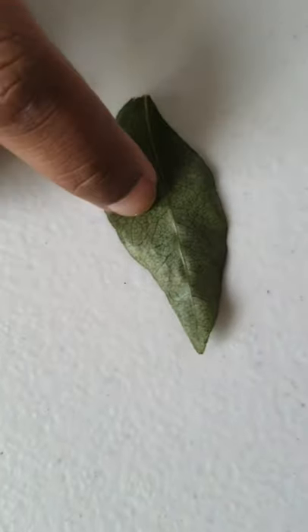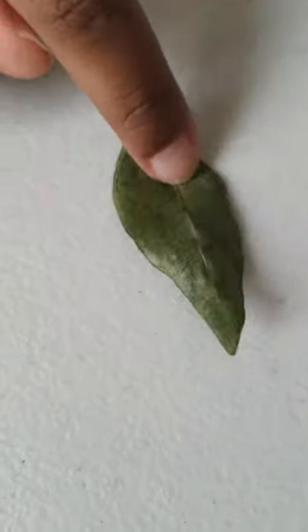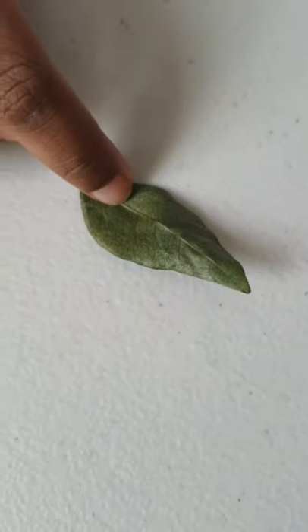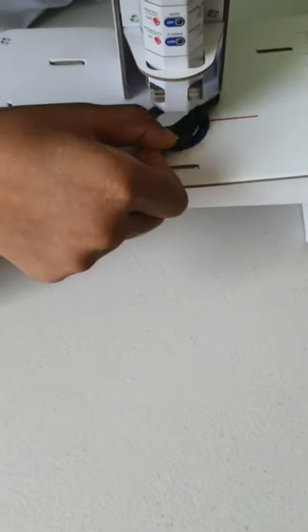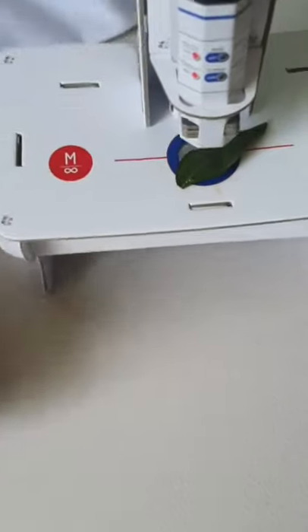These are the veins and we'll use the microscope to look at the veins and everything else more closely. So let's take it to the slide holder here and we'll have a look.